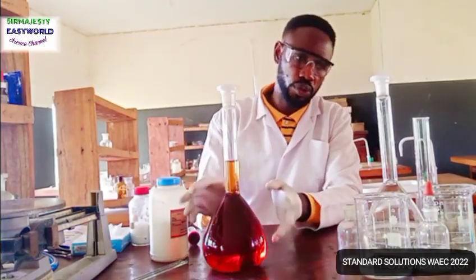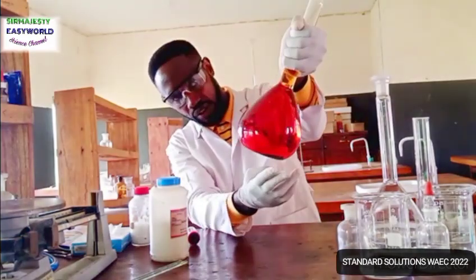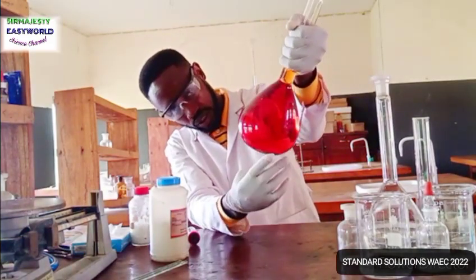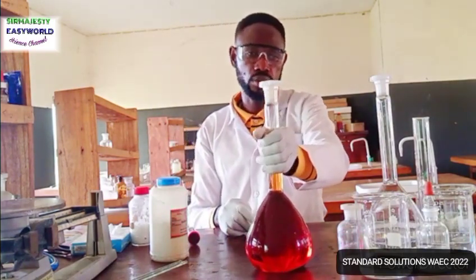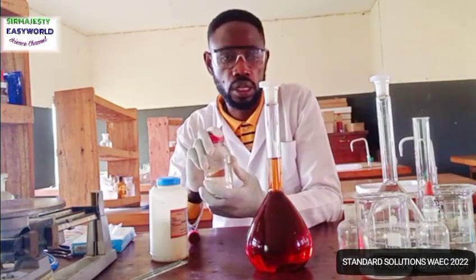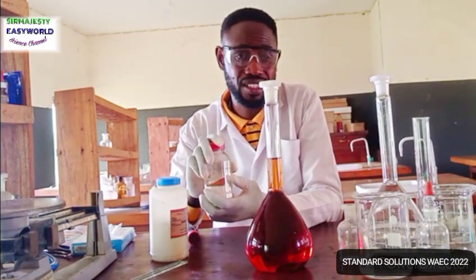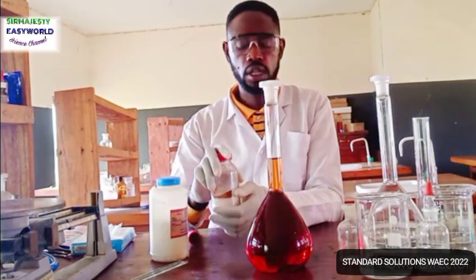Next, this is my A already. The color is even enough to distinguish between the other because this is a reddish brown color. You see, there are still crystals of undissolved iodine. They will still remain that way for a long time. But if I want the whole iodine crystal to dissolve, I will add more potassium iodide. And I say you shouldn't do that because the instruction says you should add 6 grams only. So just titrate any amount that dissolved in it.